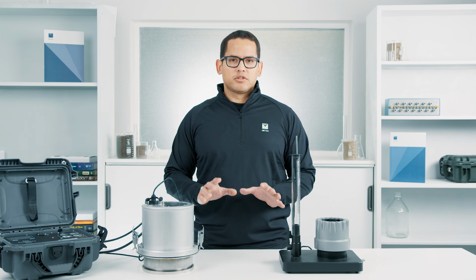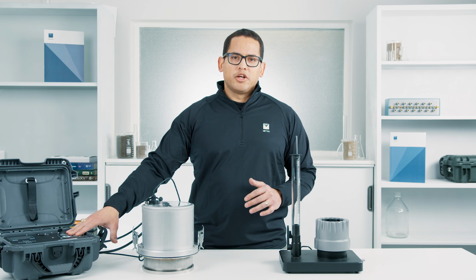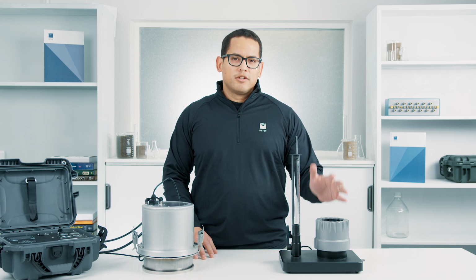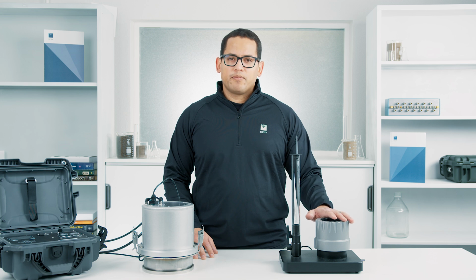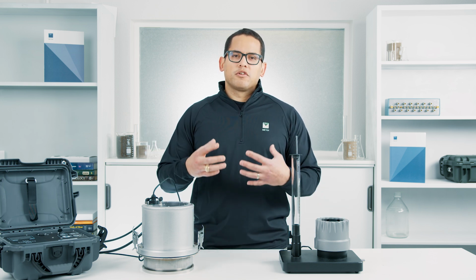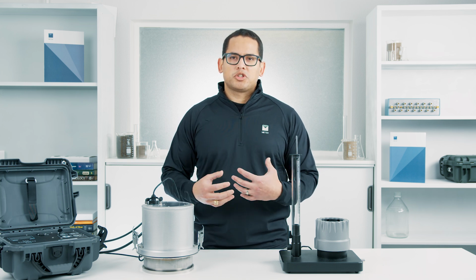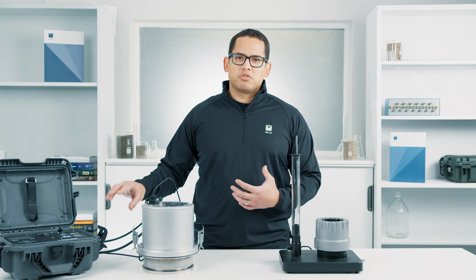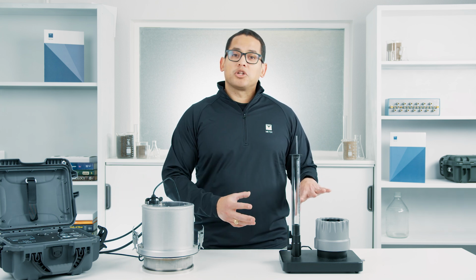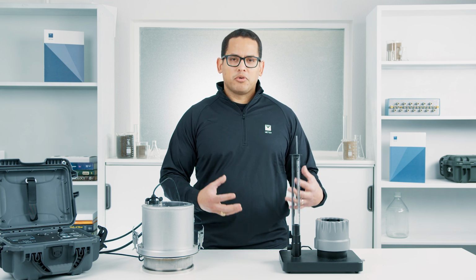And I just want to point out one other difference. You'll notice when I talk about the SATURO, I use the term field-saturated hydraulic conductivity, and when I talk about the KSAT, we just call it saturated hydraulic conductivity. And one of the reasons we do that is because in the field, it's hard to actually get the soil to full saturation. You usually wind up with entrapped air. So when we're making these measurements, we usually refer to those as field-saturated hydraulic conductivity, whereas in the lab, it's a lot easier to actually fully saturate a sample and get to that saturated point where we can refer to that as KSAT.